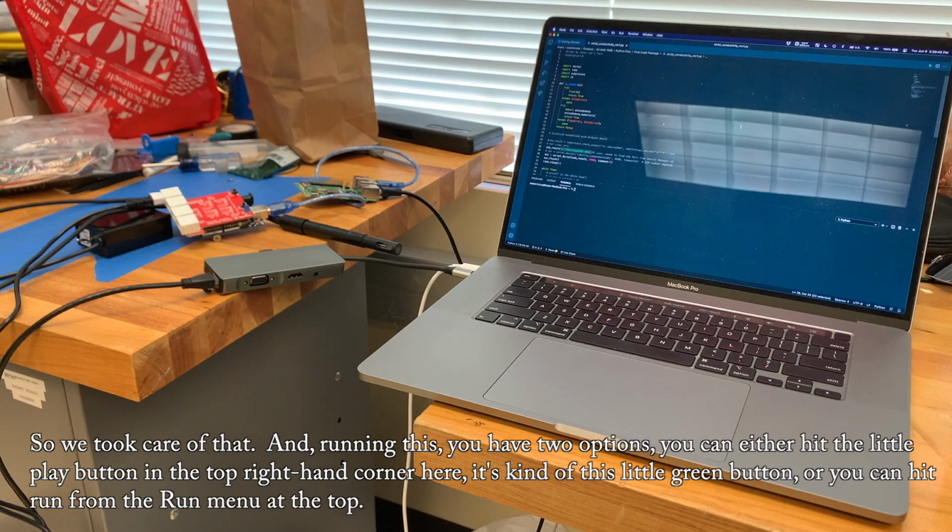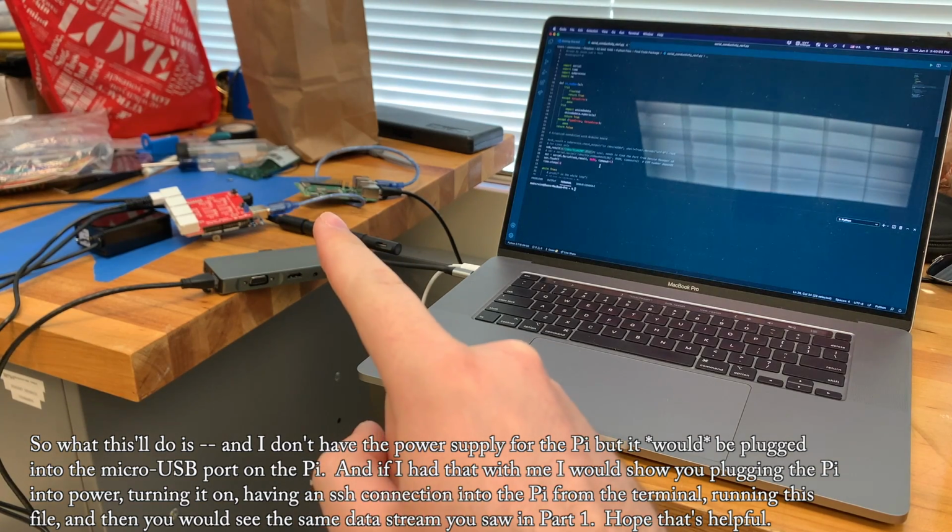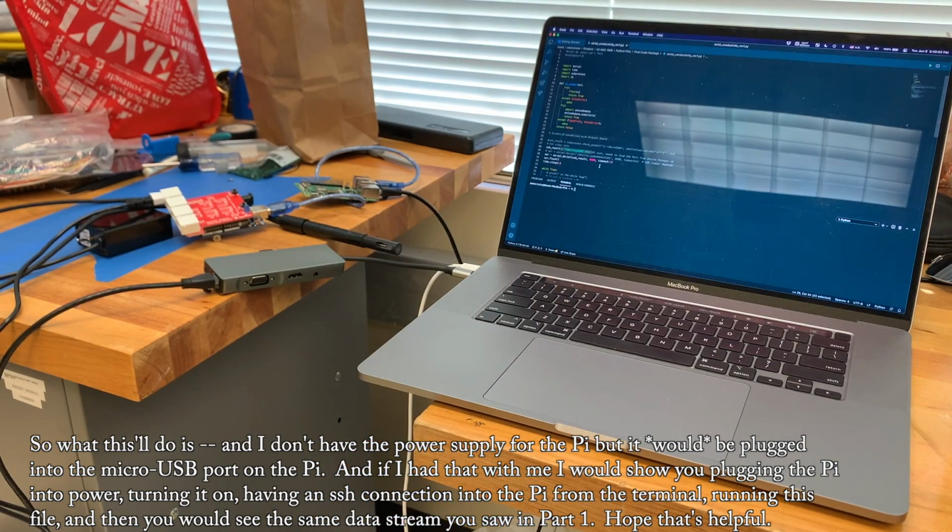And running this, you have two options. You can either hit the little play button in the top right hand corner here, it's kind of this little green button, or you can hit run from the run menu at the top. So what this will do is, and I don't have the power supply for the Pi, but it would be plugged into the micro USB port on the Pi.